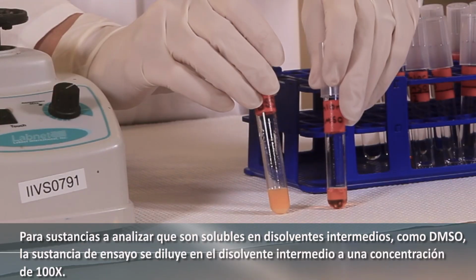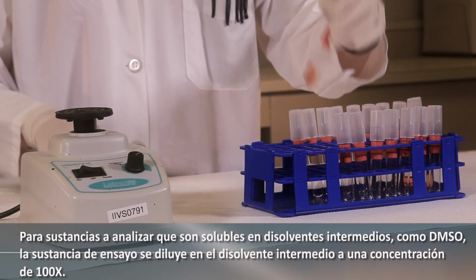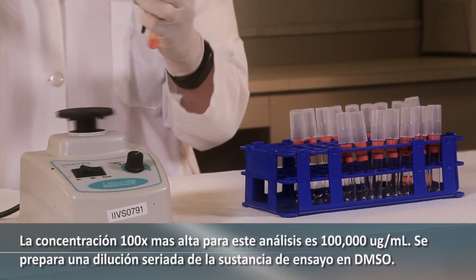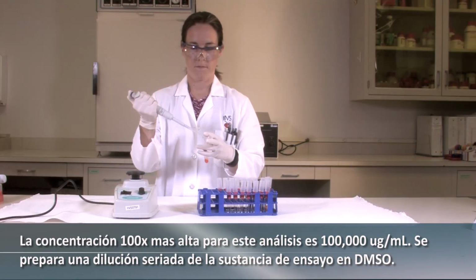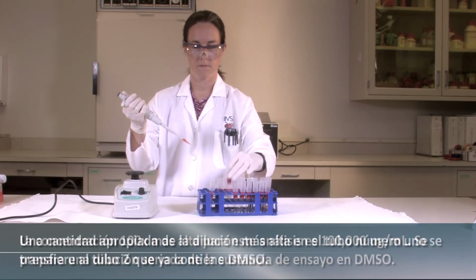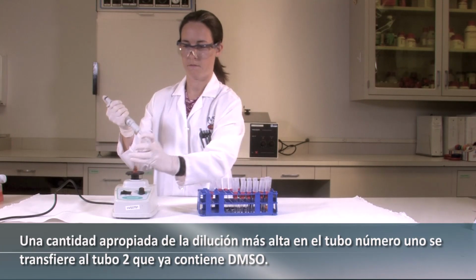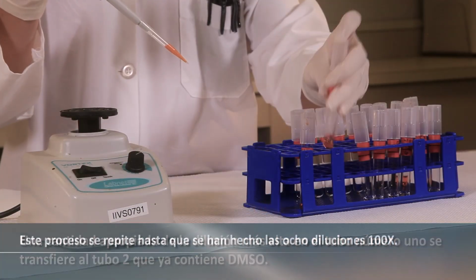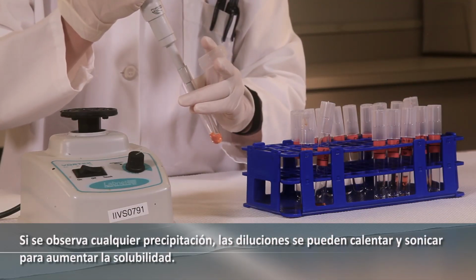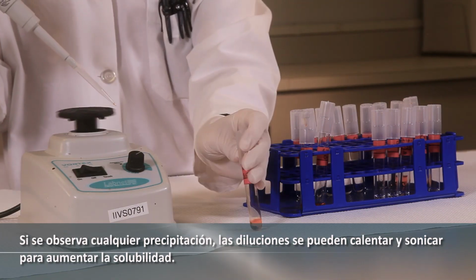For test substances that are soluble in intermediate solvents like DMSO, the test substance is diluted in the intermediate solvent to a 100x concentration. The highest 100x concentration for this assay is 100,000 micrograms per milliliter. A serial dilution of the test substance in DMSO is prepared. An appropriate amount of the highest dilution in tube number 1 is transferred to the tube 2 already containing DMSO. This process is repeated until all 8 100x dilutions have been made. If any precipitation is observed, the dilutions may be heated and sonicated to increase solubility.